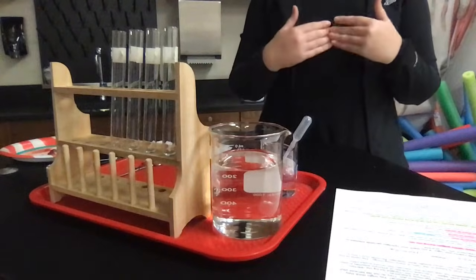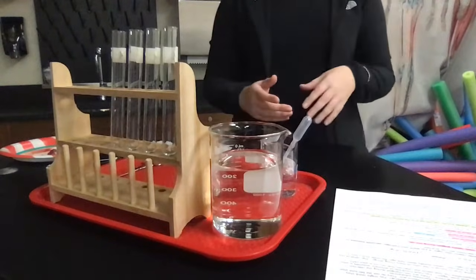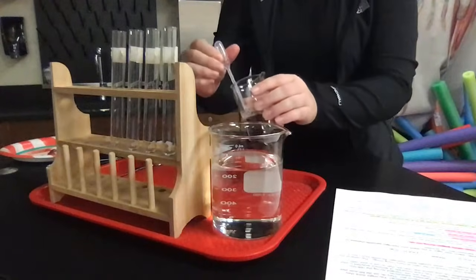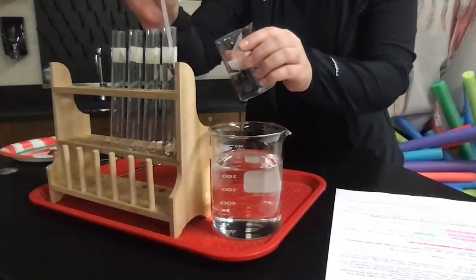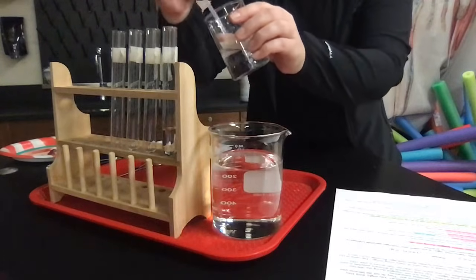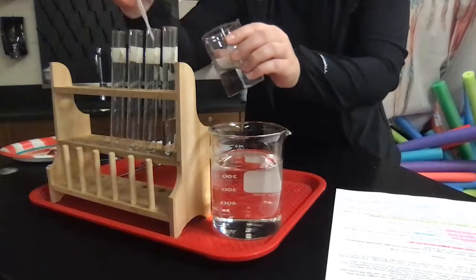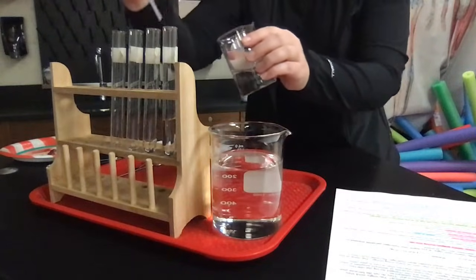So I'm going to start off and do part one of the lab for you guys that are virtual and can't do this in class. The very first thing that we're going to do is add 5 milliliters of hydrogen peroxide to each of our test tubes. I'm going to do that really quickly. Keep in mind that your hydrogen peroxide will break down in the presence of light naturally into water and oxygen, so you want to move kind of quickly with this. I'm putting roughly 5 milliliters in here for you to see these reactions take place.